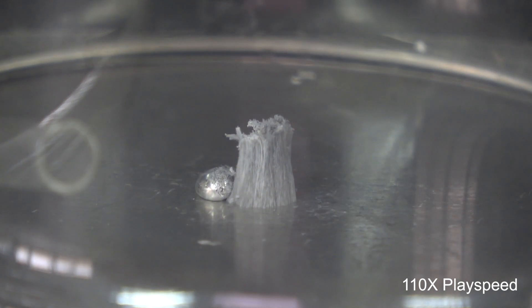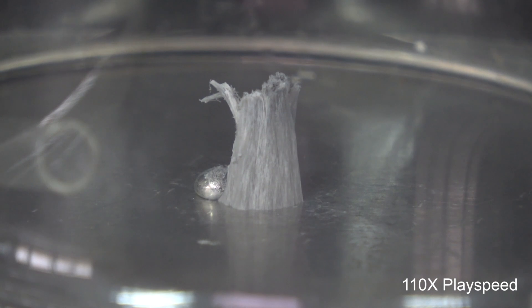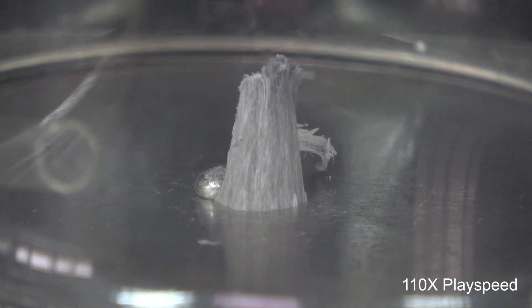What's interesting this time is that the color of the fiber became a lot darker. Instead of the snow white appearance as we've seen before, it took on a slightly grayish appearance.